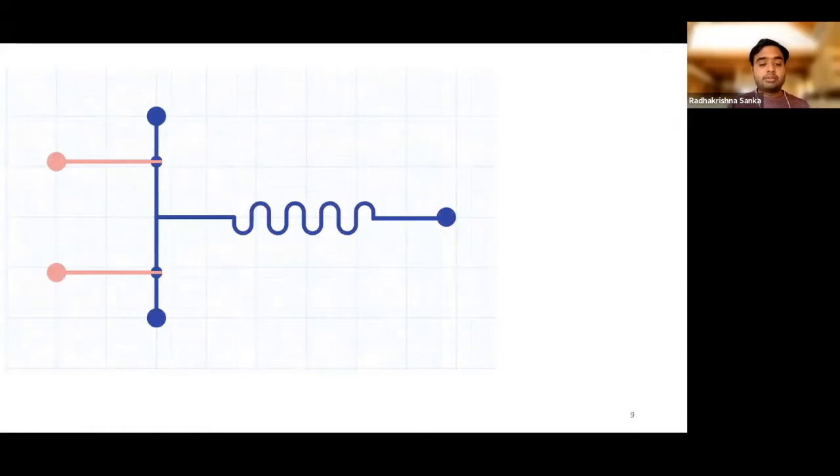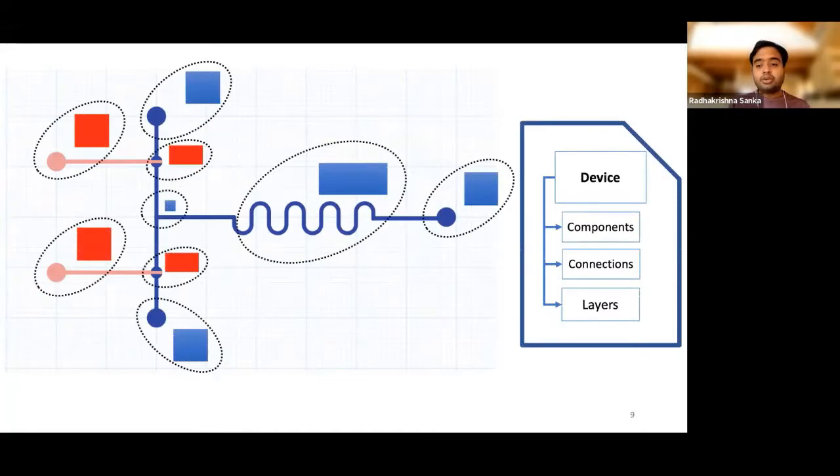Taking that example, this is how we would describe the entire device design in 3DuF. We say, okay, here is the list of components, here is the list of layers, and here is the list of connections which describe which components are being connected to one another. And by just describing all these things like a graph with some layer information, we can capture the entire complexity of a design very, very easily.